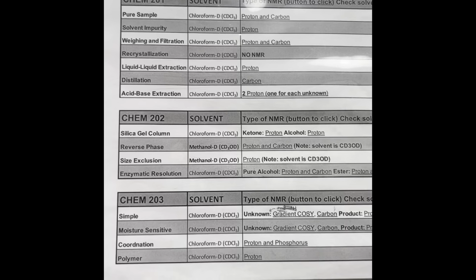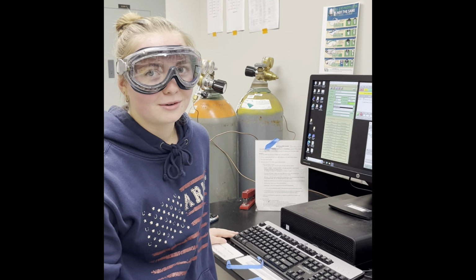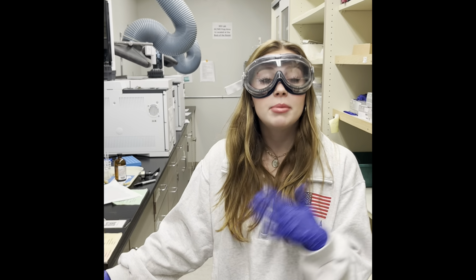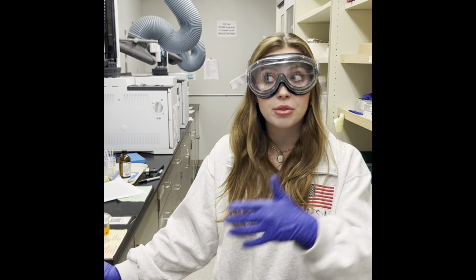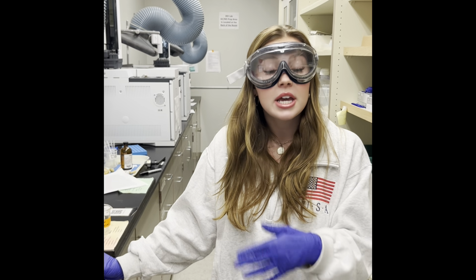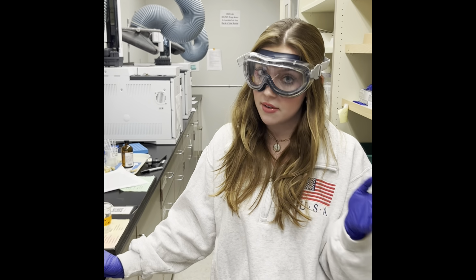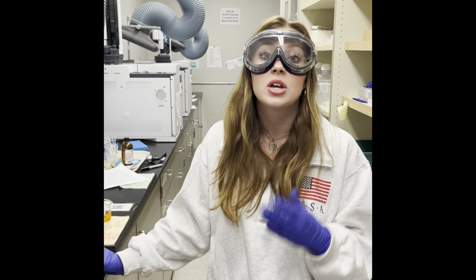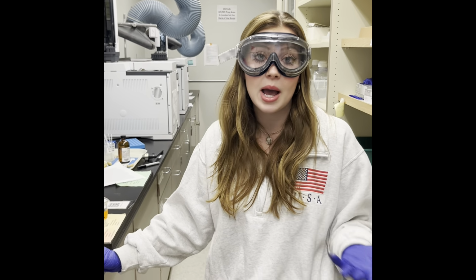What do I do if my data doesn't come through right away? Your lab results may take a day or two to come through. Because we actually have to run the samples through the NMR instrument, it can take some time before they're available for you. If more than a few days go by and you still have not received your samples, you definitely should reach out to your professor ASAP so they can help you find your data for your lab report.